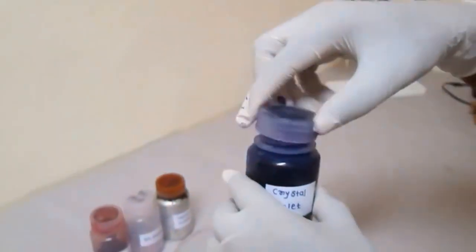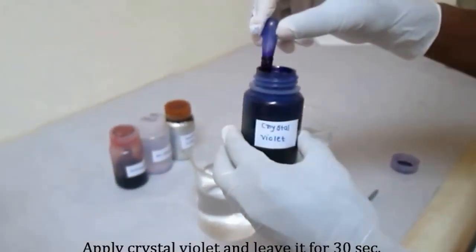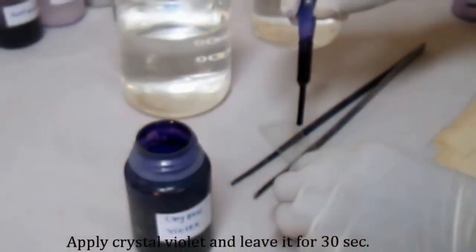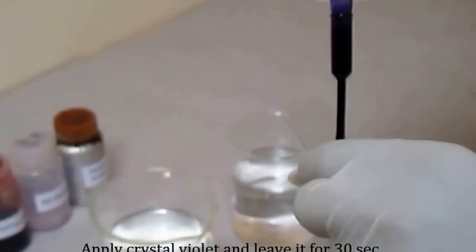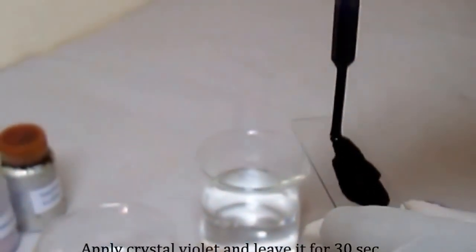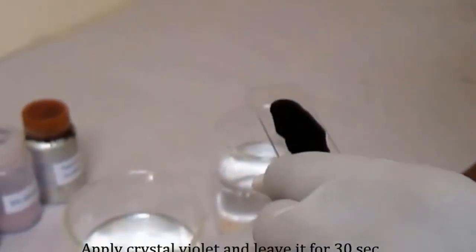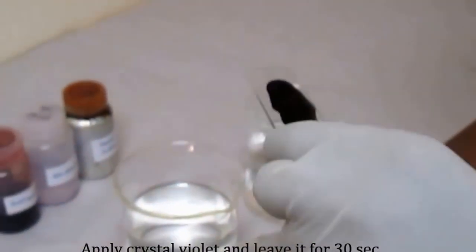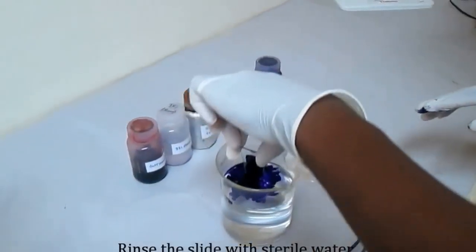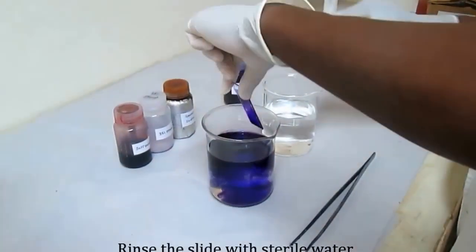Crystal violet. It is blue in color. It acts as a primary stain. It stains both gram-positive as well as gram-negative bacteria. Apply it on the smear and leave it for 30 seconds. After 30 seconds, just rinse the slide in the sterile water in such a way that most of the dye gets off.